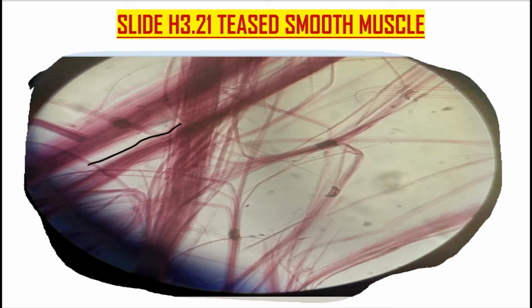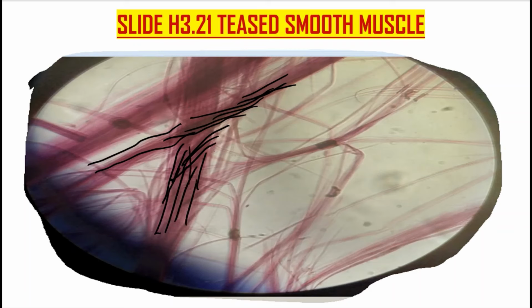So these are just muscle fibers of smooth muscle. You're only able to appreciate the muscle fibers. Just draw this the way it is, and label it as smooth muscle, teased muscle fibers. They're very visible.